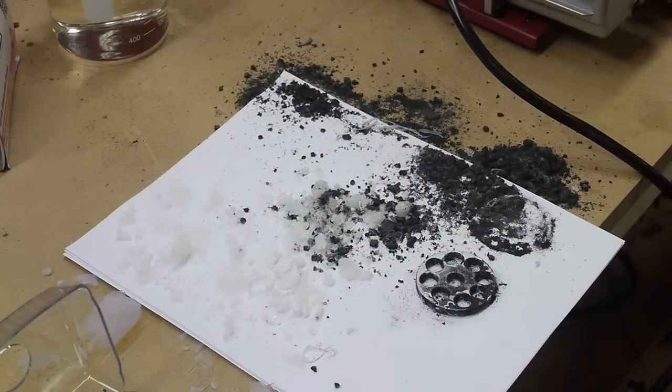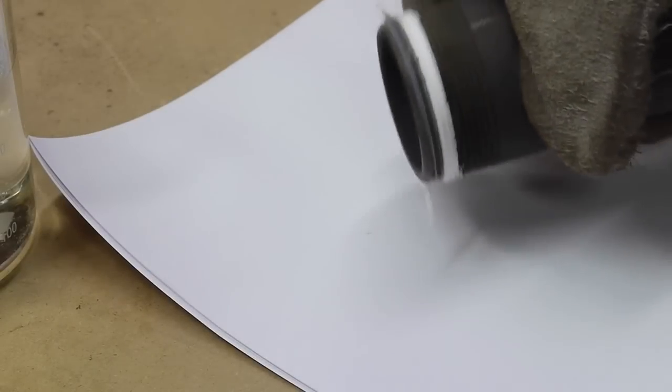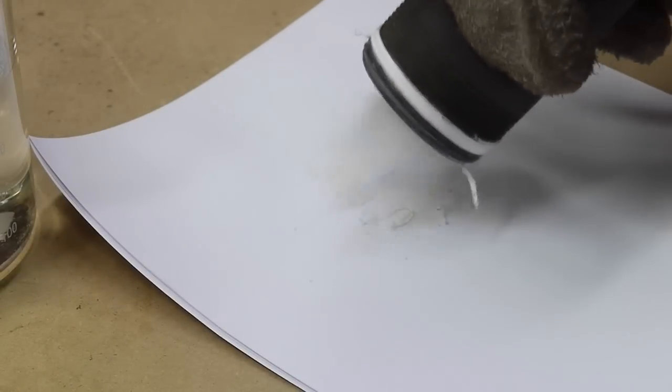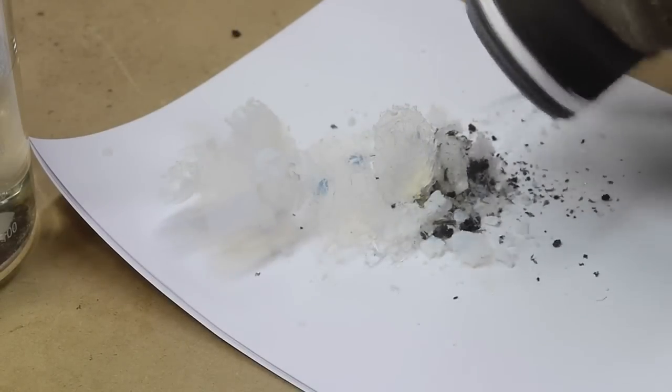Here's one thing that I didn't expect. When I dumped out the contents of the chamber, the aerogels that were kind of near the top looked okay. I mean, they're cracked, but at least they're normal looking aerogel. But the stuff at the bottom of the chamber was kind of mixed in with this ash, kind of a soot or something at the bottom.